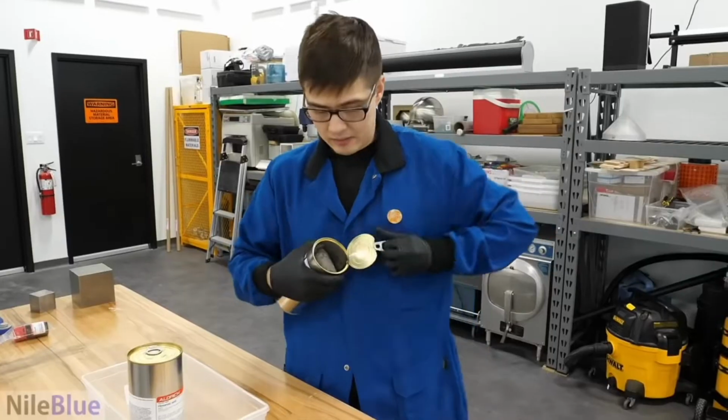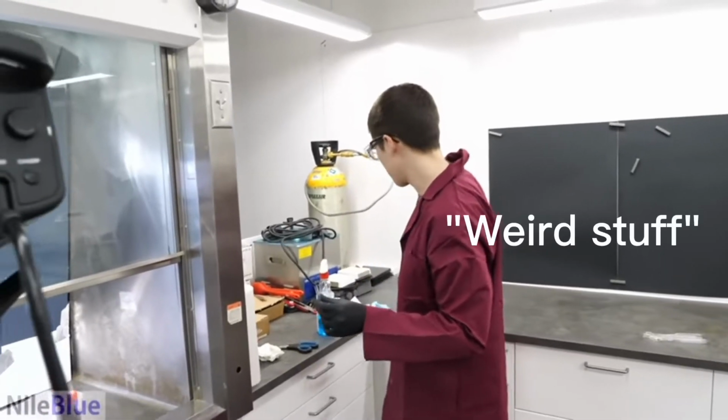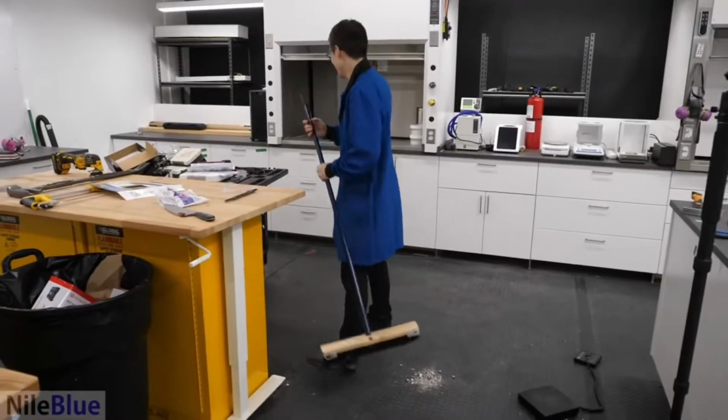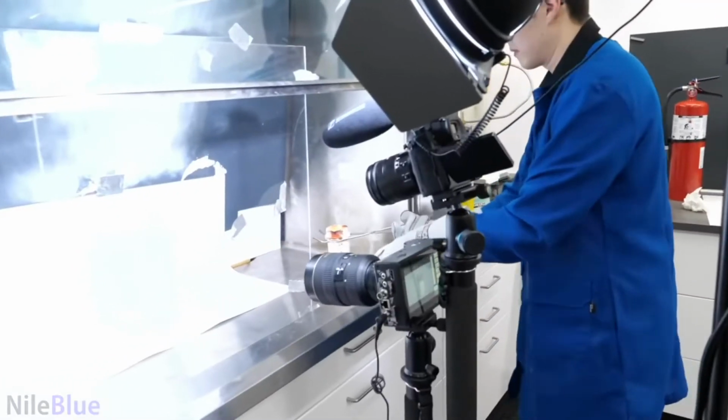My God. I don't know, all my pipettes have weird stuff in them. It's only in them too, it's not on them. What do you see? That's not it.